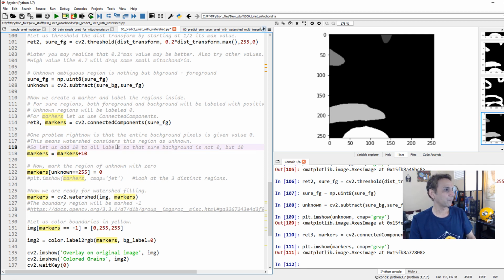Okay. So again, the reason why we are doing this is that for all values of 0, watershed thinks that this is an area it has to work. So our unknown is the only region that needs to have a pixel value of 0, and everything else should have non-zero pixel values. So watershed only looks at pixel values of 0 and works right there using other information. Yeah, that's exactly the reason why we are doing this.